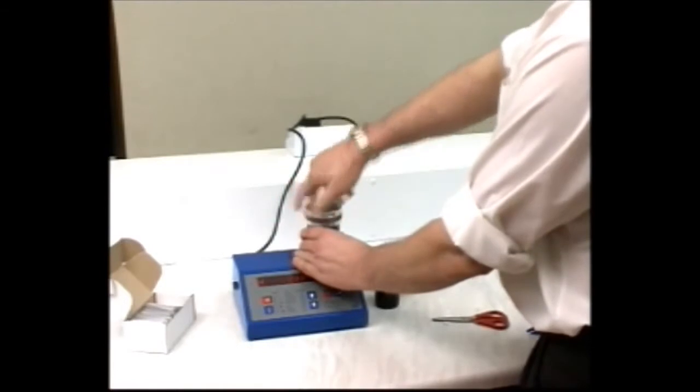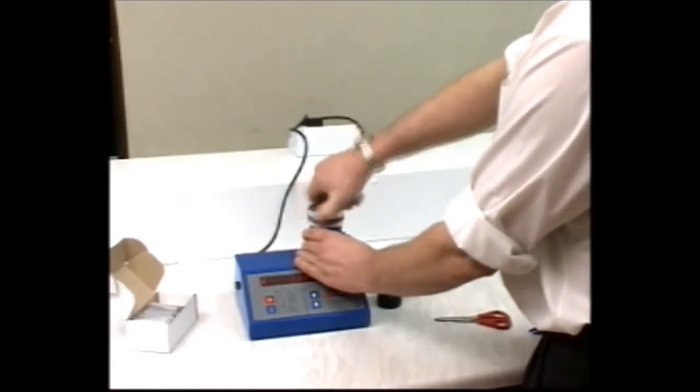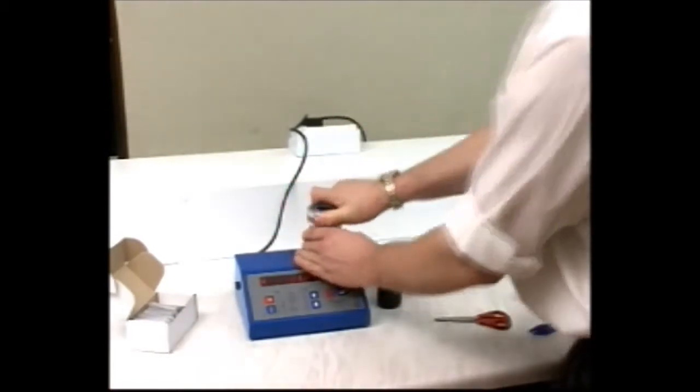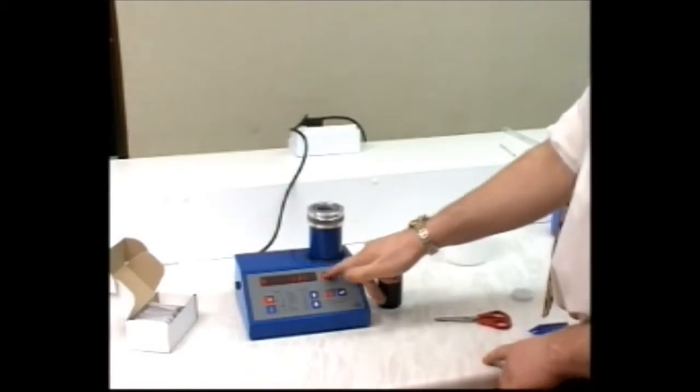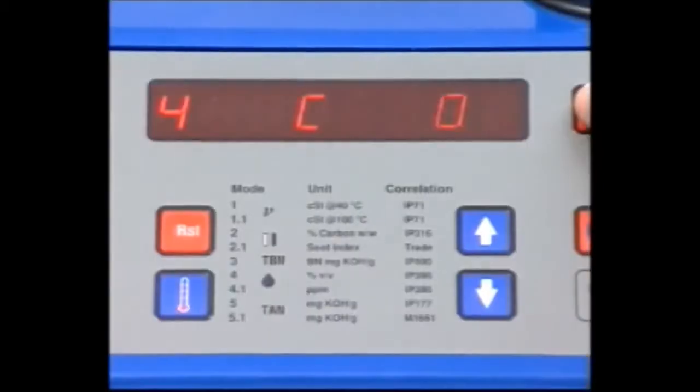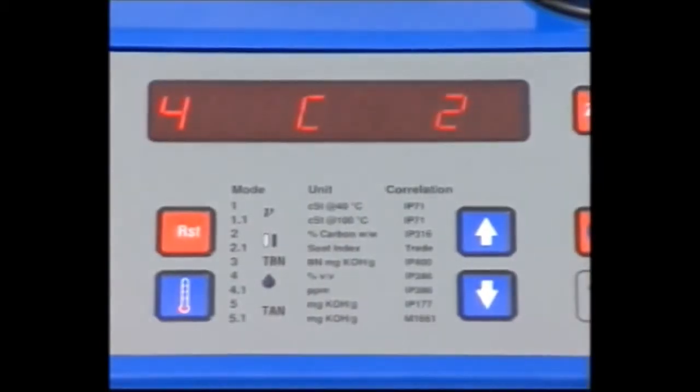Wait until the reading has stabilized. Press the button marked 0 to reset the reading and start the count.